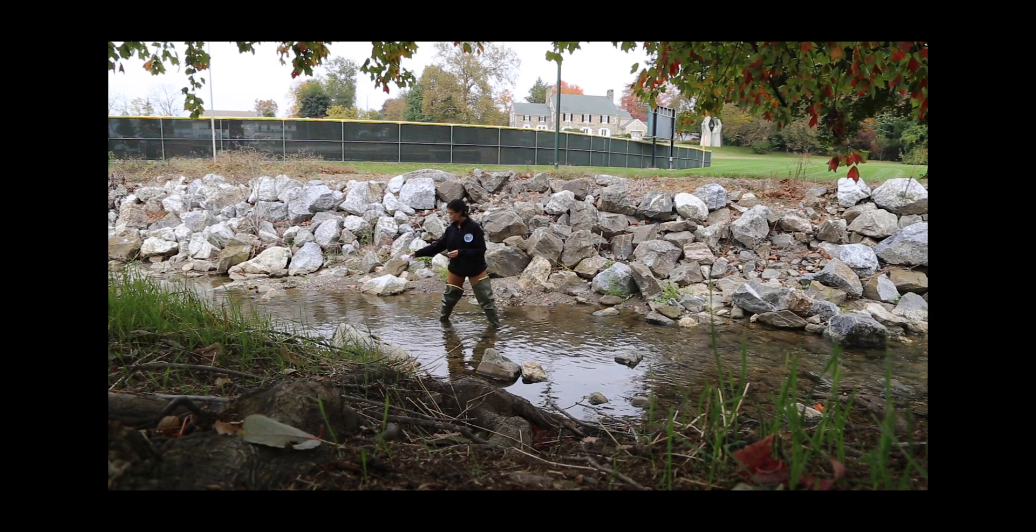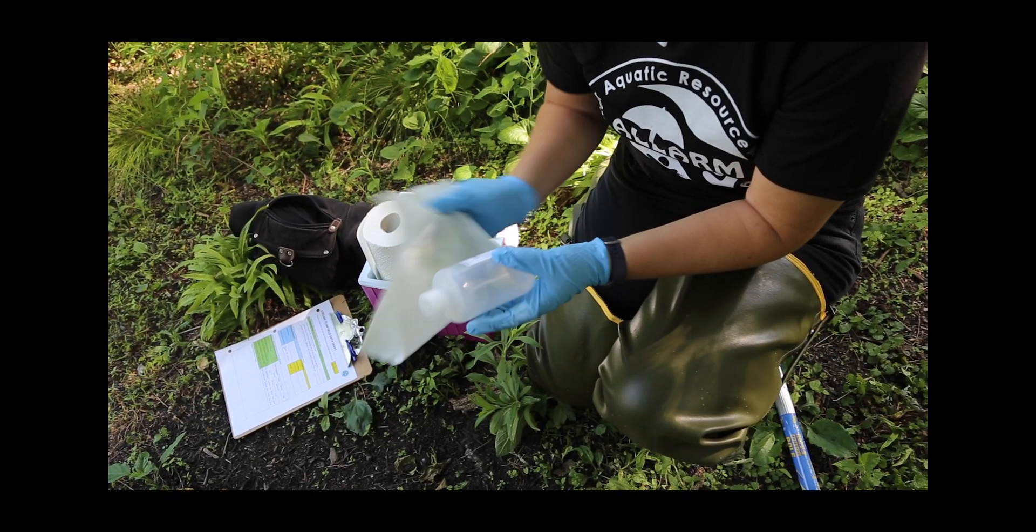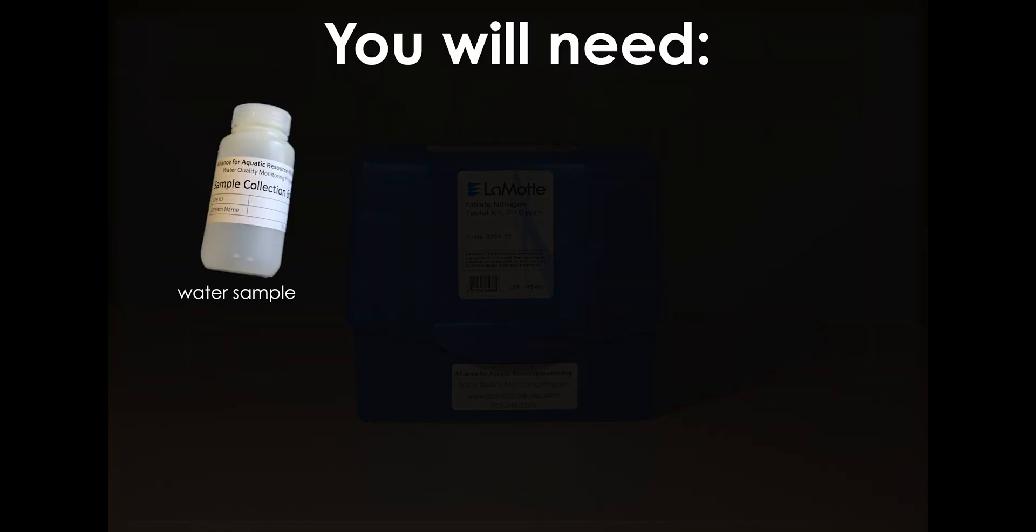Thank you for safely collecting a water sample and transporting it to your testing location in a cooler with an ice pack. For measuring your sample's nitrate-nitrogen values, you will need to test your sample within 48 hours of collection.